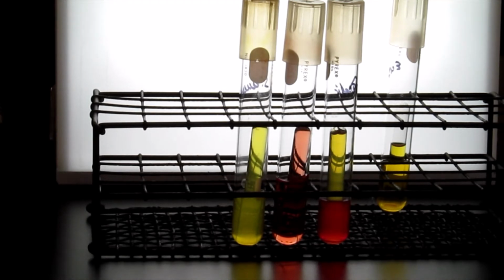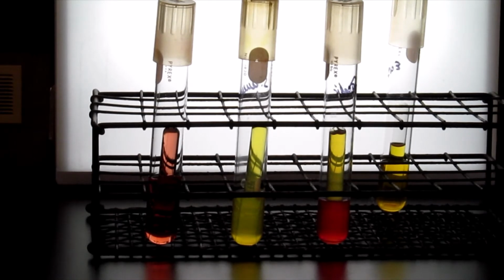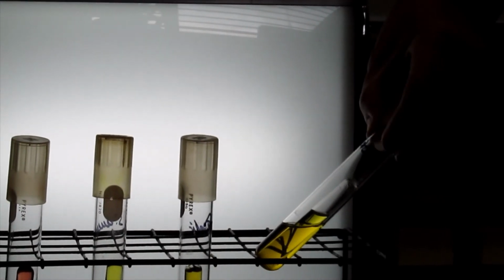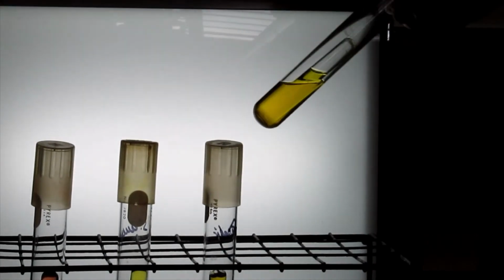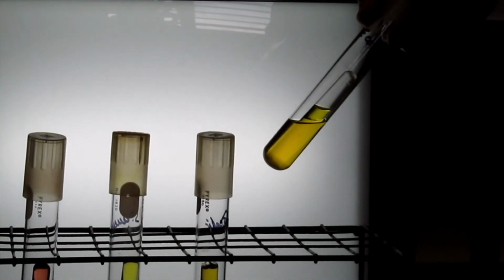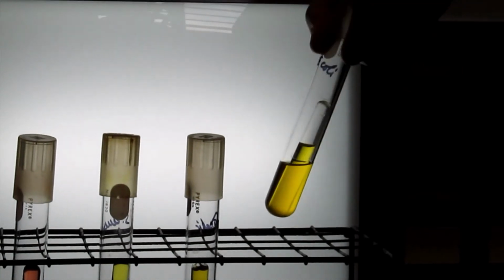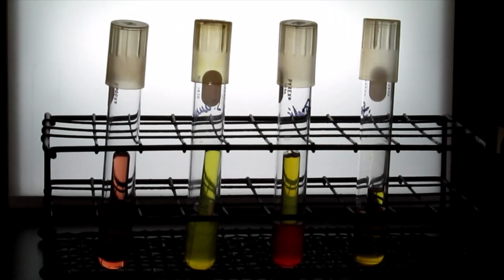The other information you can get from incubating your bacteria in this media is whether or not you can produce any gases. And in this case, we have E. coli that's been incubated into the media, and the result is, first of all, you see the yellow color in the media, so you say, oh, it's taken the lactose and produced acid from that fermentation. And you also notice that inside the Durham tube, there's been an accumulation of gas, and so you know that gas has been produced in the fermentation of lactose, typically CO2 or hydrogen gas. So that's an indication of how that particular bacteria will ferment the sugar that's present in your starting material.